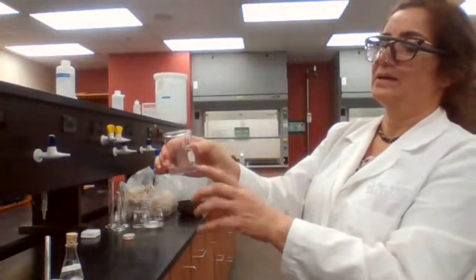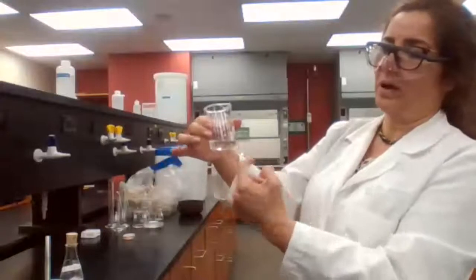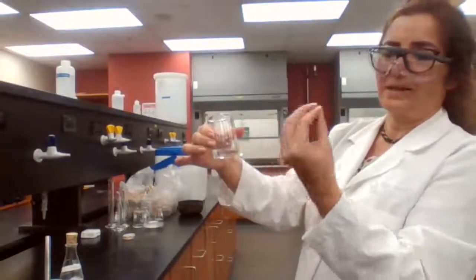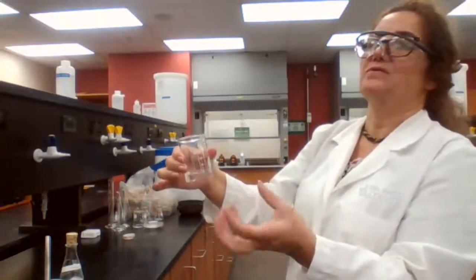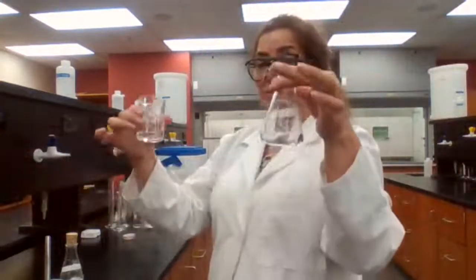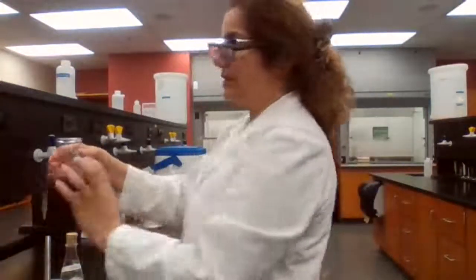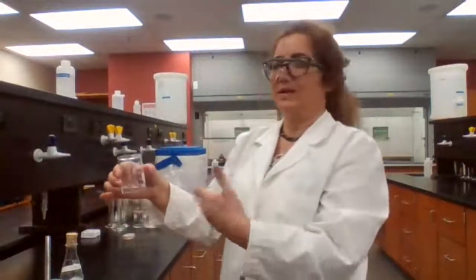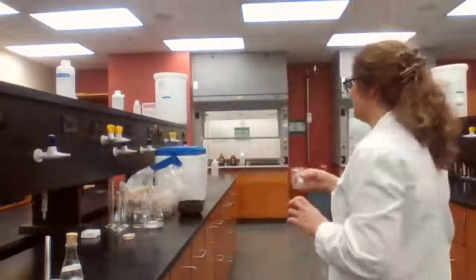When the ether dries, the organic neutral compound is going to stay on the wall of the beaker as a white powder, and that is our neutral organic compound. Because it's not the point of separating. We have separated now, but they are both in solution form. We also have to recover it, because if we don't recover, we are not going to get the product. Separation has to be followed by recovery. We have to end up with two solid compounds. Okay? So I'm going to place the beaker in the fume hood.